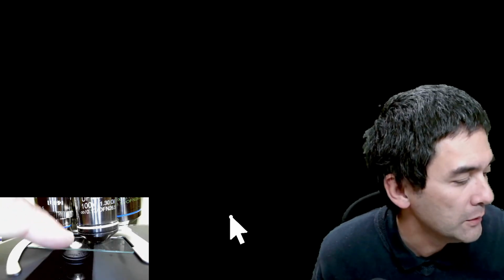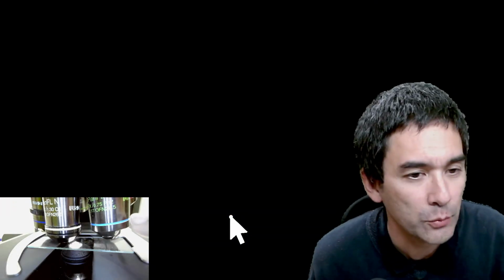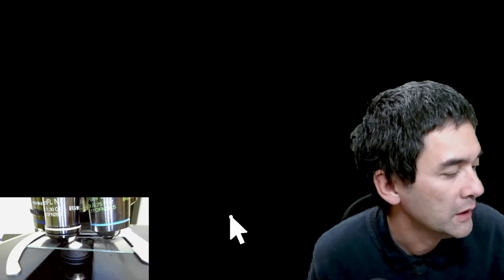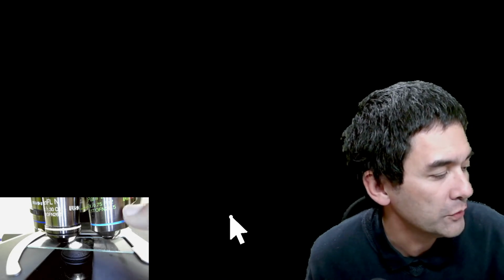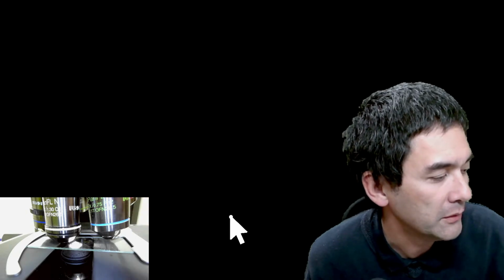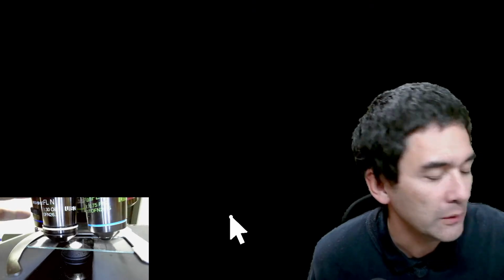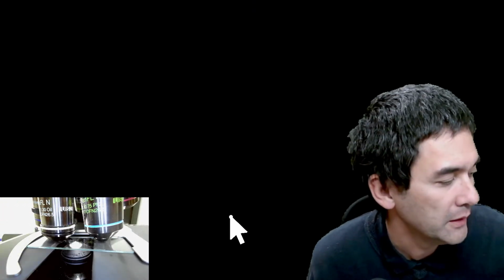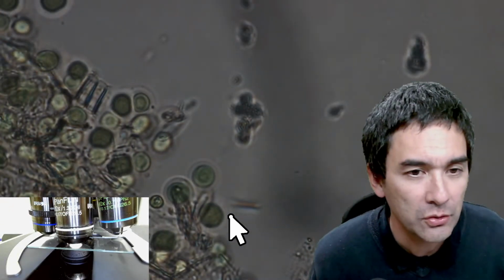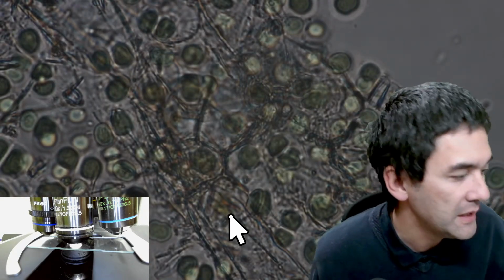If you don't have this focus lock lever, you carefully rotate it away. You put a drop of immersion oil right in here, and then back. Or in my case, I have got another 40 times objective, a phase contrast objective over here. But in your microscope, most likely you won't have a large objective blocking the space here. Most likely, it's a short 4 times objective. So there you'll have enough space to add immersion oil. But what I'm going to do now is, say that this is now in focus.